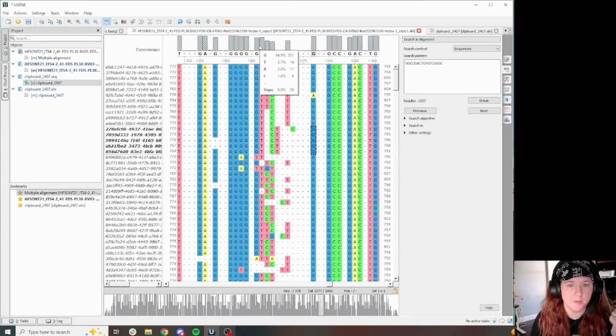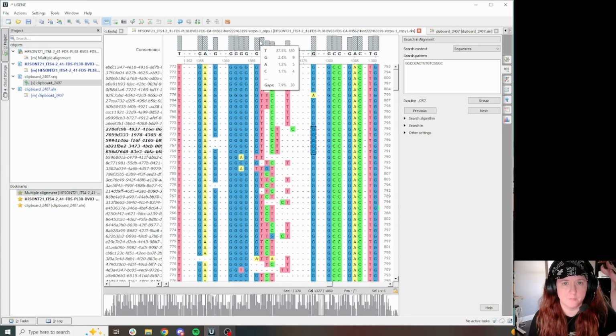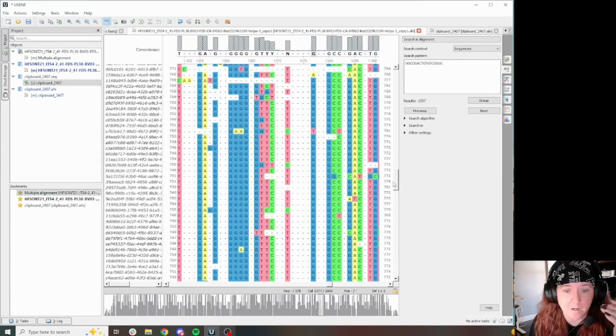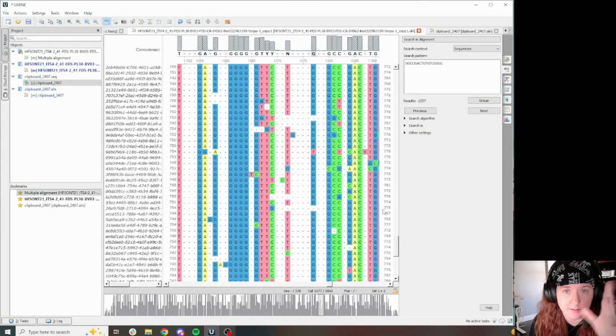So hovering over here, we see this T is solid, right? 87% T's, 330 of the 378 reads in this FASTQ have this T present. This Y, so we're 64% T, 22% C. So if we continue scooching these C's over, we're still going to have a fairly strong presence of T's in this position. And we will also then have a pretty solid presence of C's in this position and a pretty solid presence of T's in this position, right? And it aligns fairly nicely when we do that, even though it isn't exactly what the mapped alignment spit out in the first place.